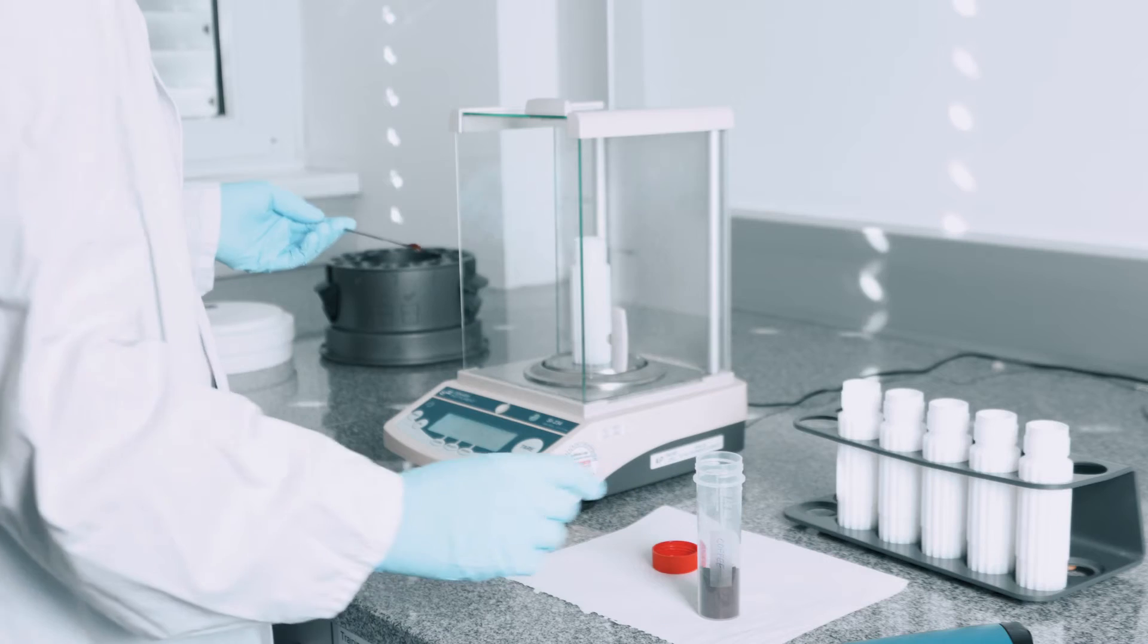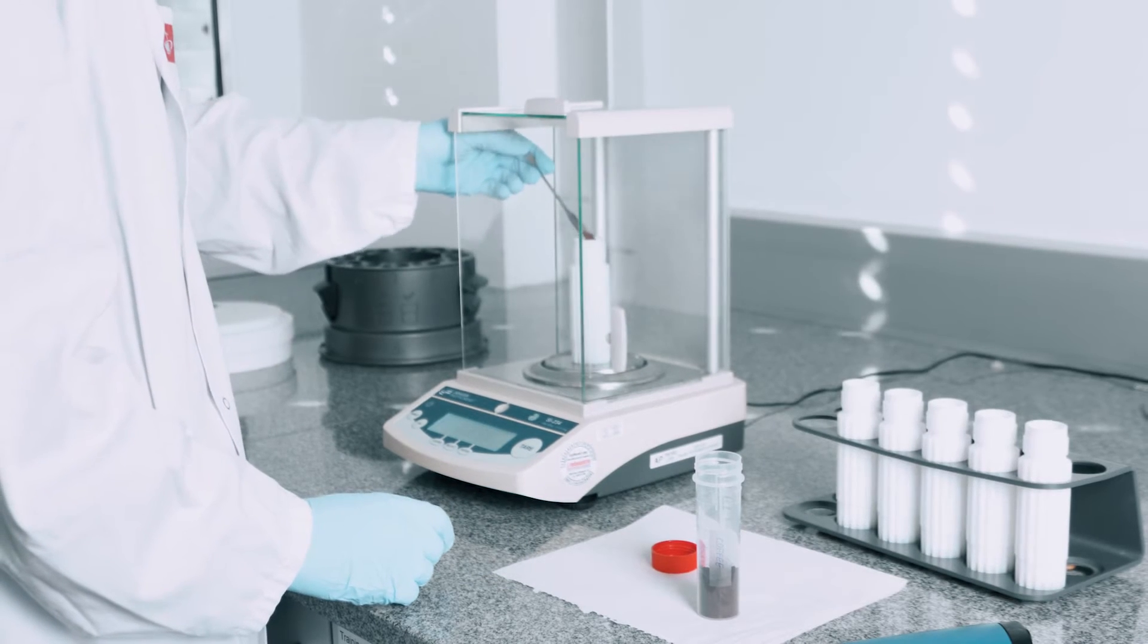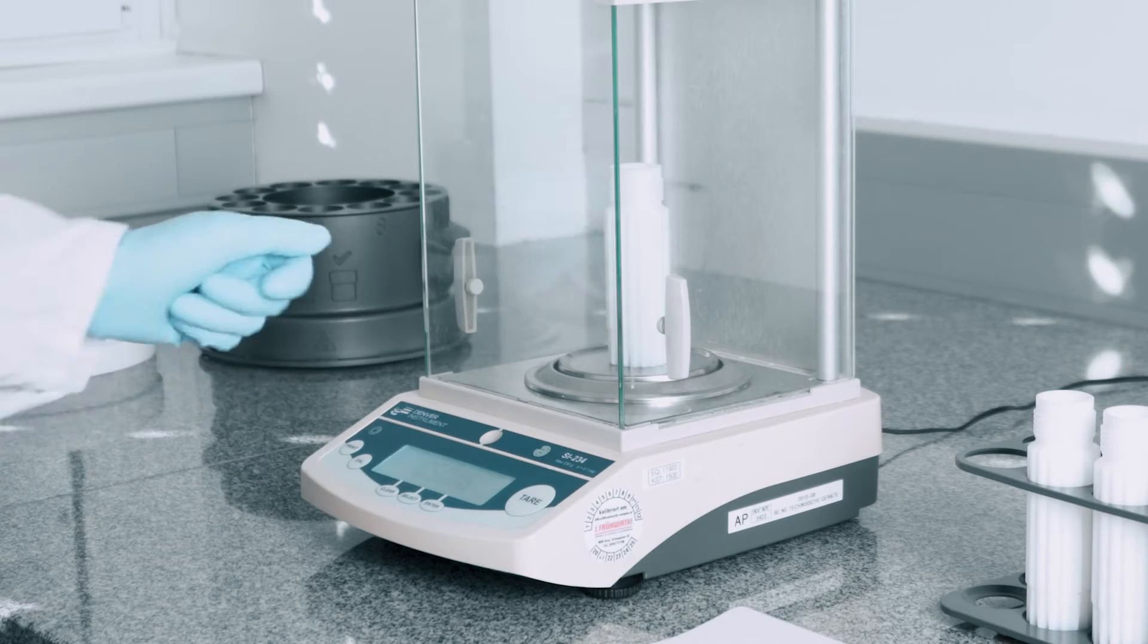First off, we weigh the sample in this lightweight, flat bottom vessel, which sits nicely on the scales.